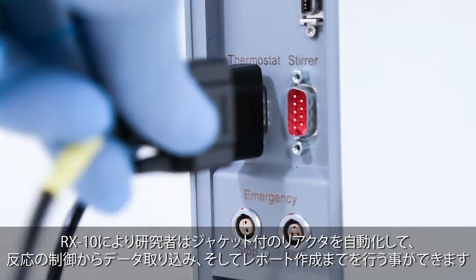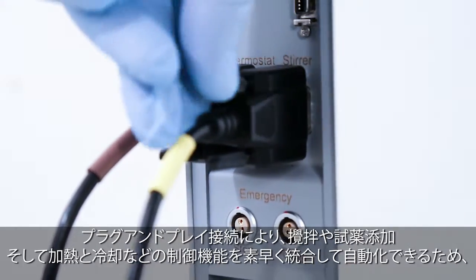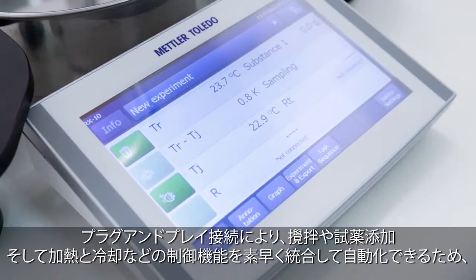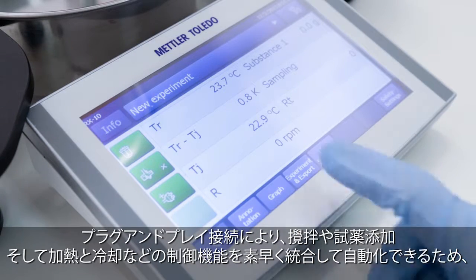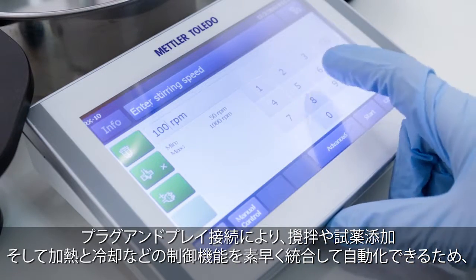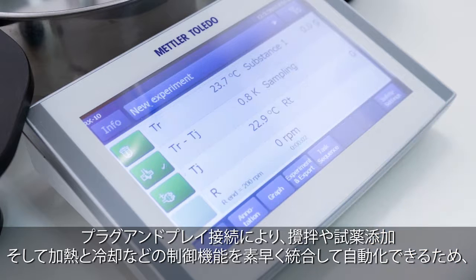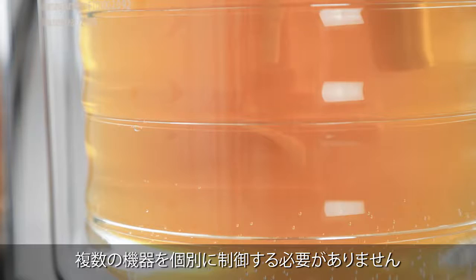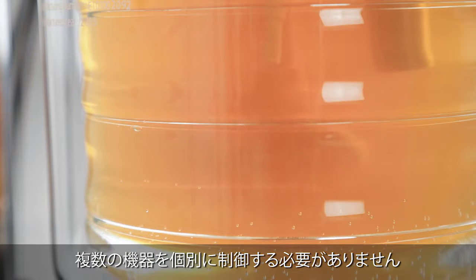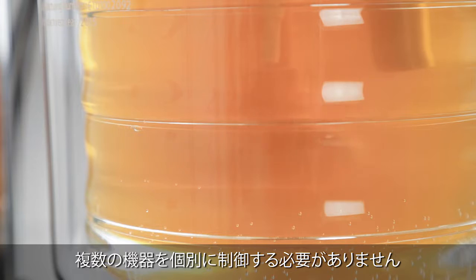Plug and play connections allow laboratory control functions like stirring, dosing, heating and cooling to be quickly integrated and automated, eliminating the need to learn and manage multiple control interfaces.